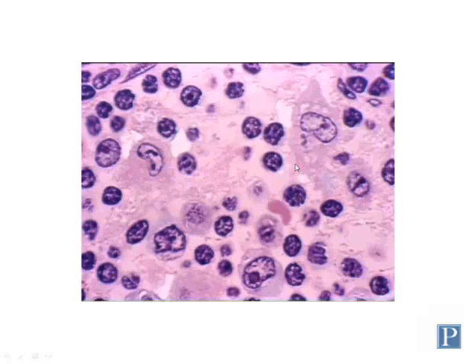The other major cell type you can see here are macrophages. And macrophages are large phagocytic cells. They are derived from monocytes, a different type of leukocyte that we're going to discuss later on. And they're just huge cells. You can see the nuclei here. The nuclear envelope stains very dark because of the large presence of heterochromatin around the nuclear envelope.